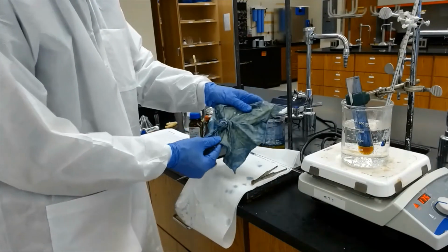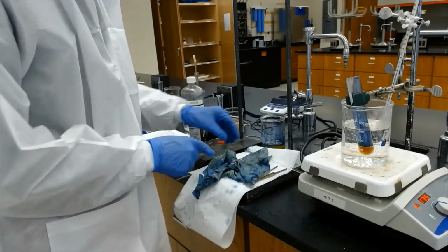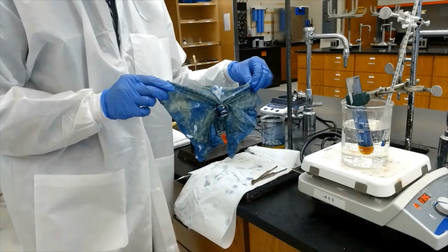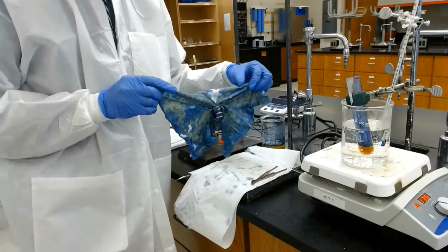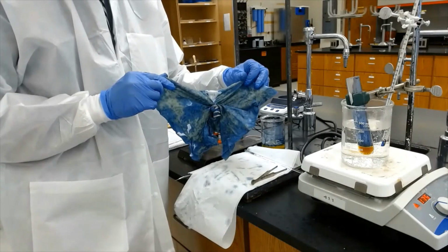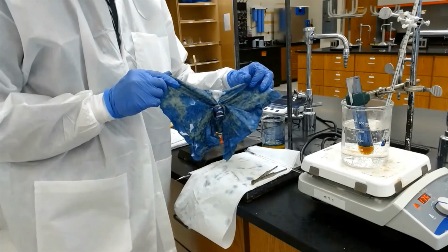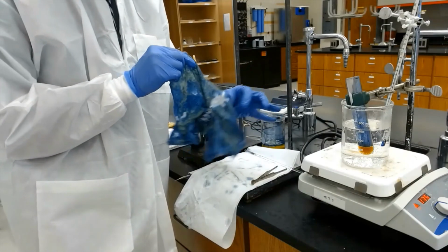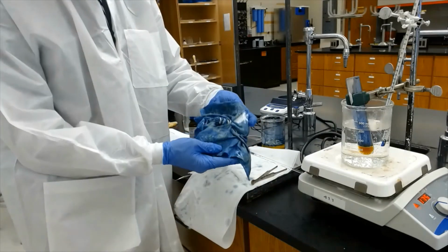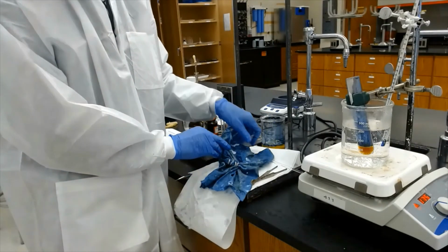but when it turns blue, I'm going to open this, remove the rubber band and then wash it right away. So this is the cloth, as you can see, and as we speak, the color is turning to blue, right? That's because the reduced form of indigo is now becoming reoxidized back to indigo, and that's where you see the blue color. So the color keeps intensifying more and more to the blue. So I leave this for a few more minutes.